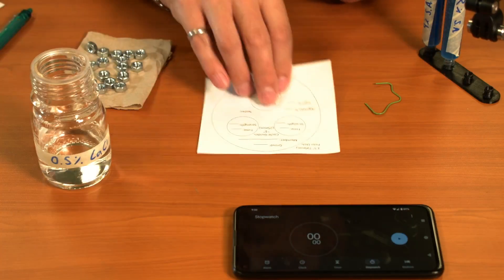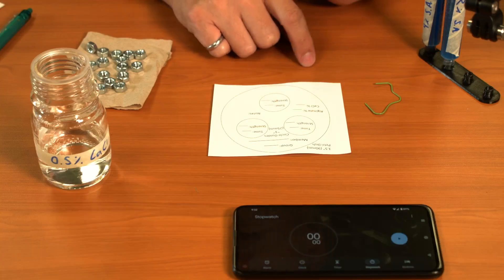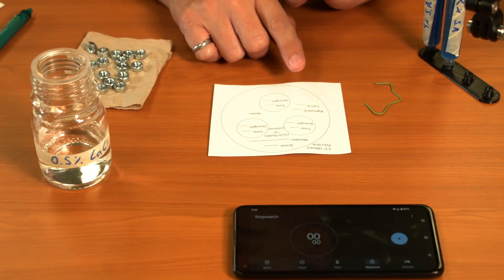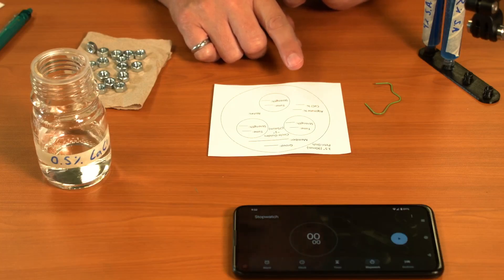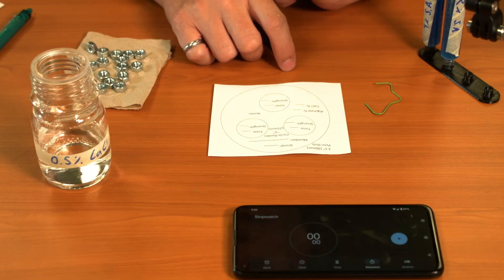I've also got some guides here, and I'm going to use these to help me keep track of my individual experiments and to make sure that the circles that I'm making, the rings that I'm making, are of consistent size.